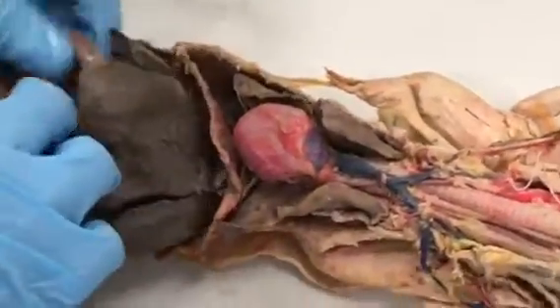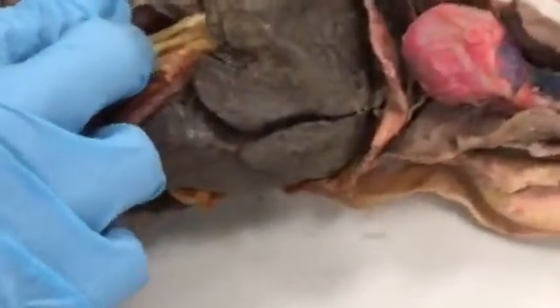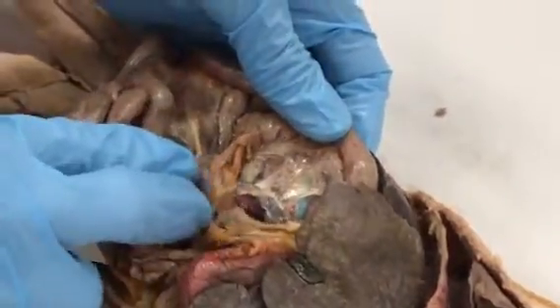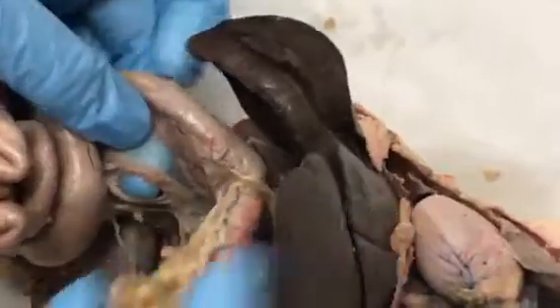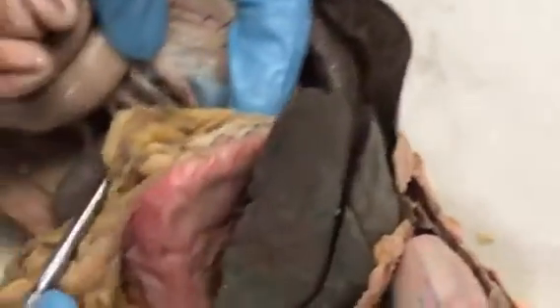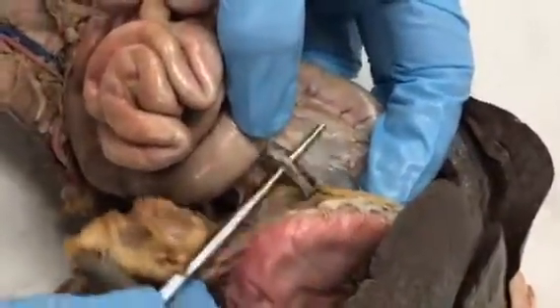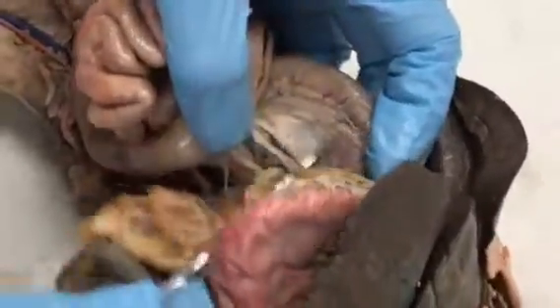And there's one more vein we need to know associated with the hepatic system called the hepatic portal vein, and it runs right along with the pancreas. So it's right here. It's probably a little bit better on this cat, I think. So we find the pancreas, and then on some cats it's dyed yellow, and these not so much. So it's just either sort of a brownish blue color right here. Hepatic portal vein right there.